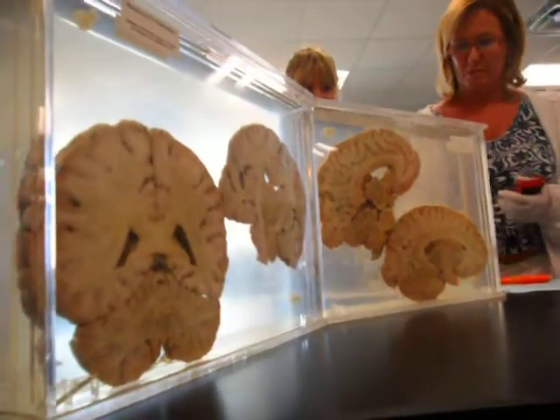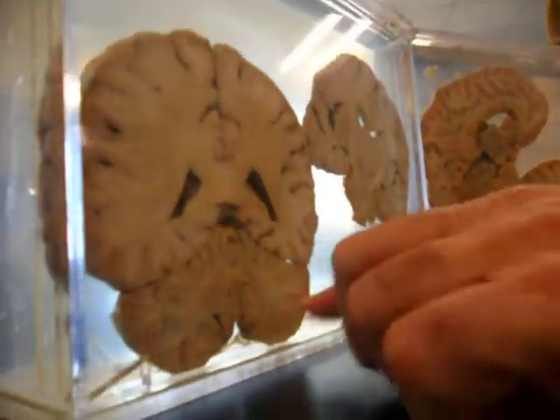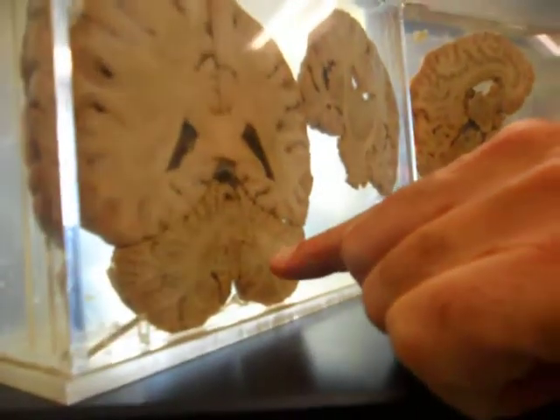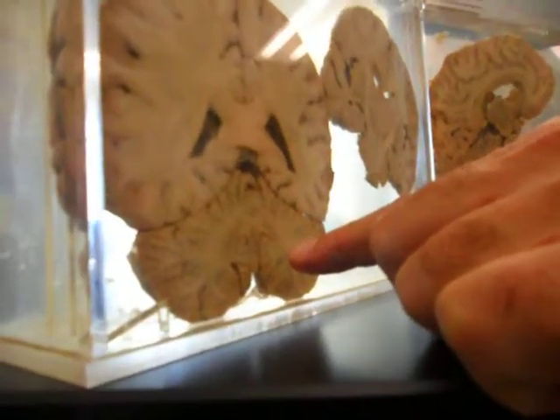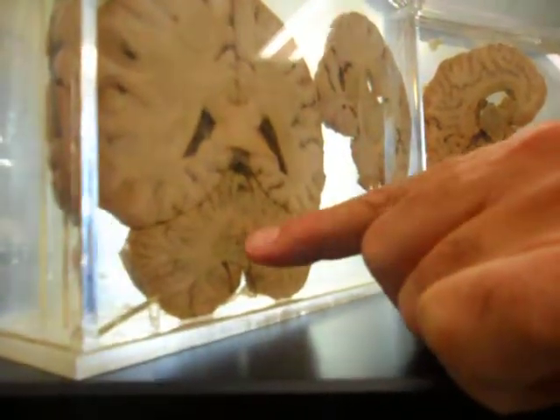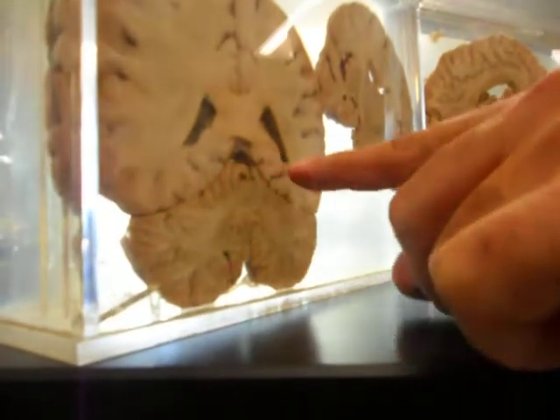I'm going to ask, and I want you to think. What part of the brain is this? Cerebellum. Well, the white is called the arborvitae. You're correct. But what lobe? This is the cerebellum. If that's the cerebellum, then what line is right here?